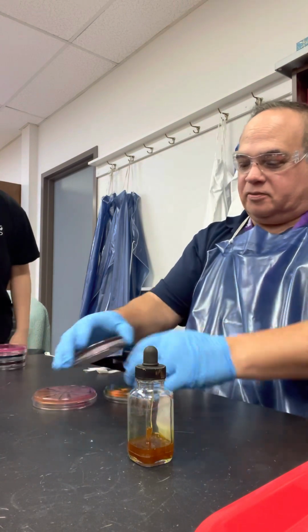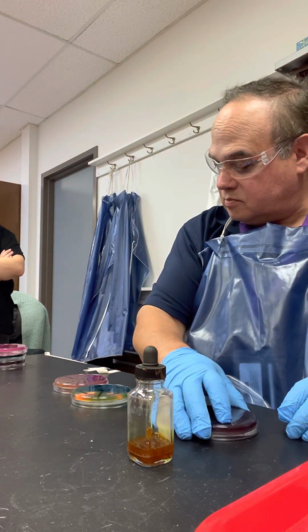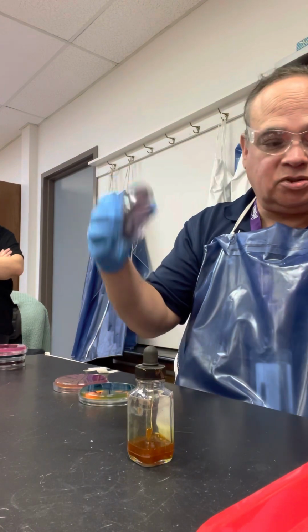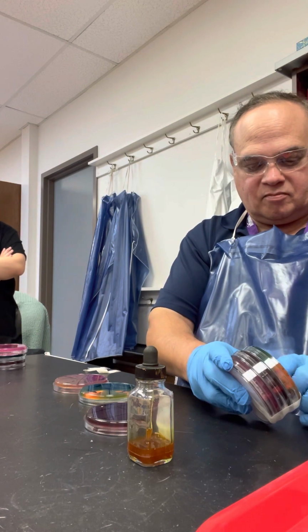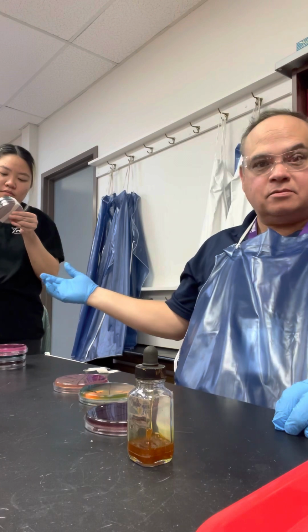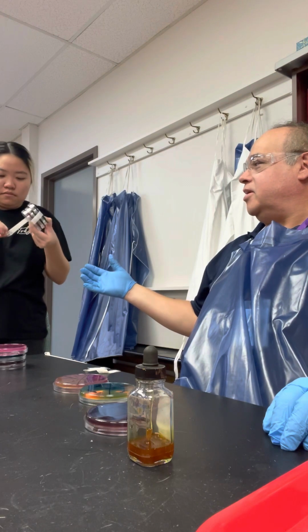Okay, so this is, oh. Are those the group ones that you wanted from us? This one was 4 quadrant streak. Let me look at this one. Yeah, that was supposed to be the one that goes in the fourth line. Do you want me to pick it with my fingers? I've got acrylics, so it might be able to peel better. Any day now? Okay, good.